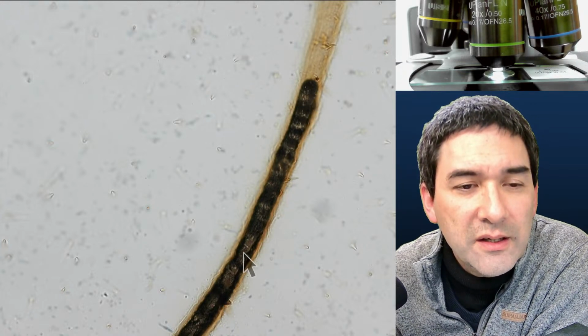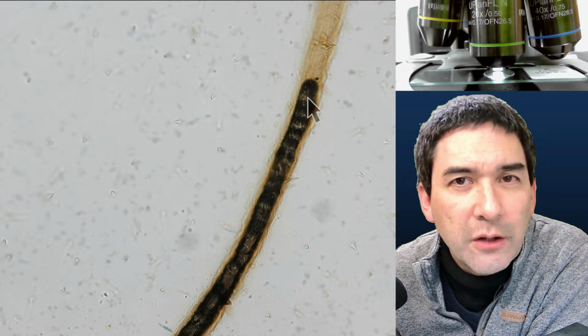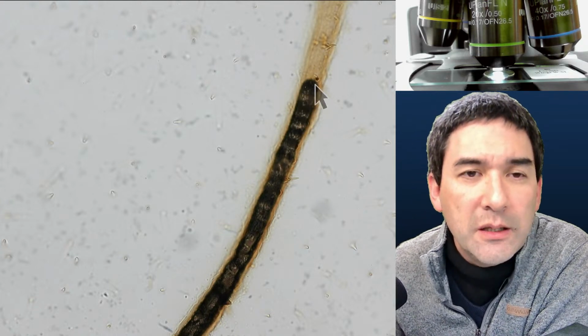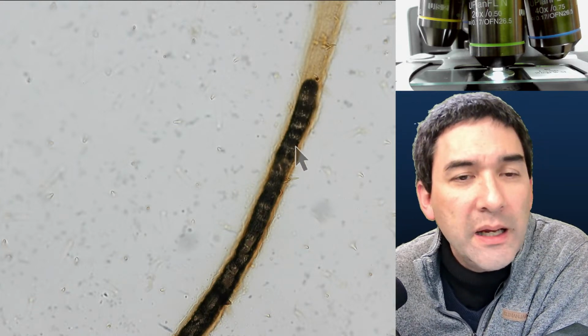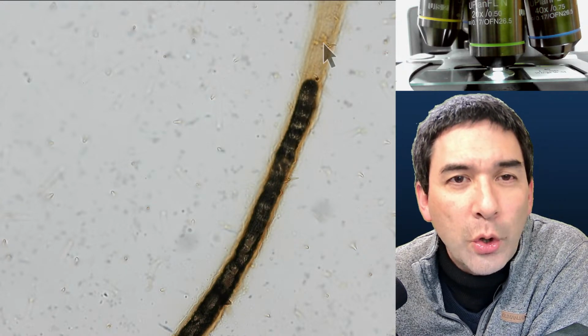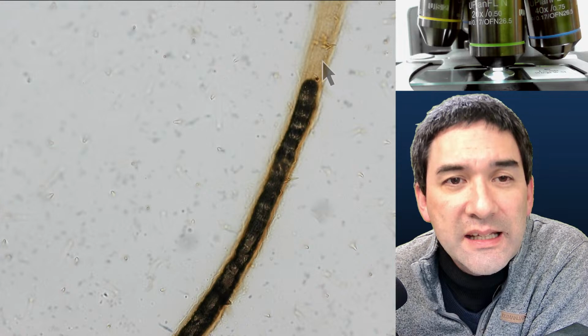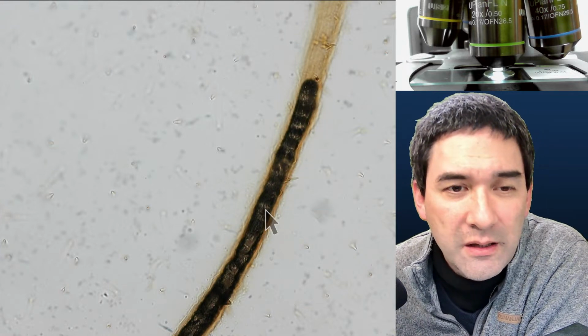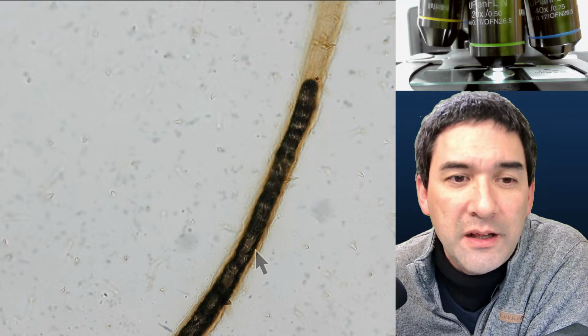Because of the large difference in refractive index between air and the surrounding medium, air enclosures usually appear quite dark. This also shows that the inside of this vessel must be hollow, otherwise there wouldn't be any possibility for air to be in there, right?